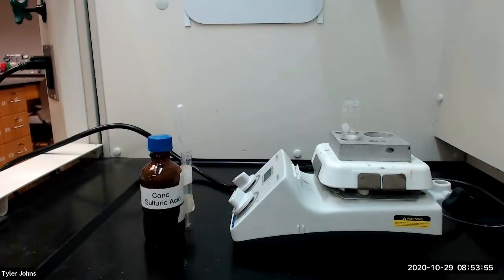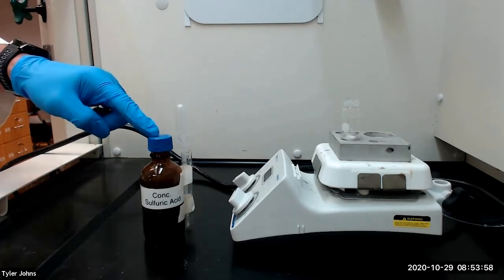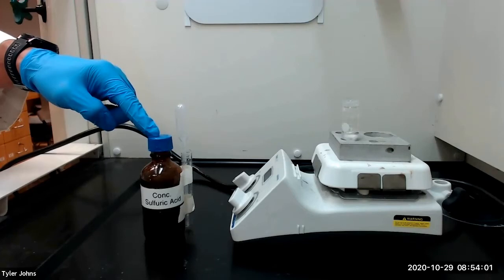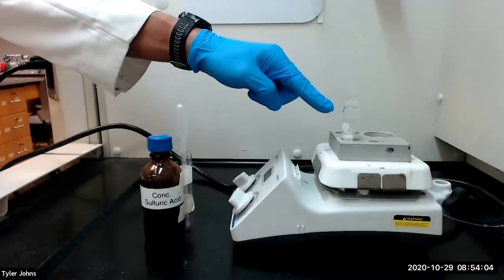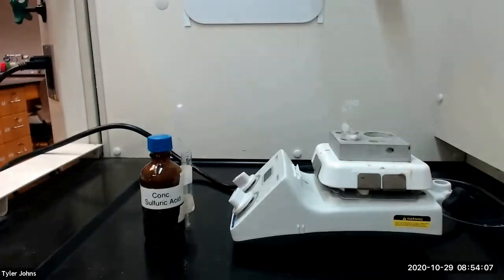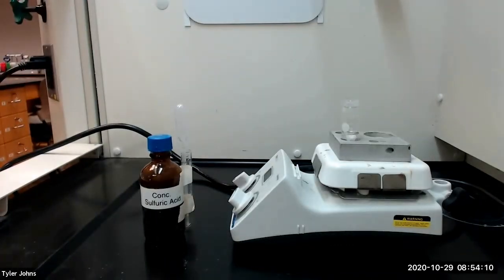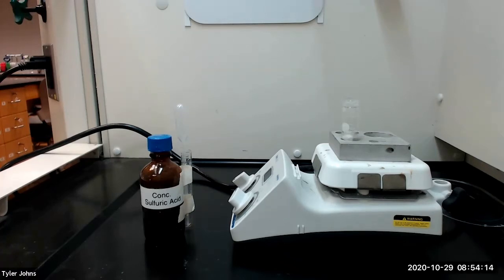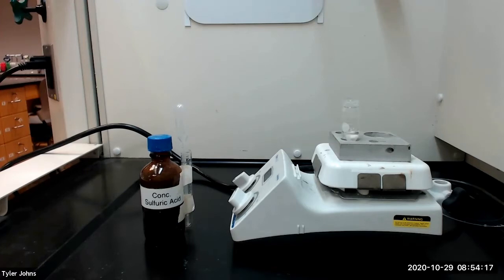After our salicylic acid has dissolved in the methanol, we will next slowly add 0.75 milliliters of concentrated sulfuric acid to our 5 milliliter conical vial with stirring. At this point a white precipitate may form, but it will re-dissolve during the reflux period. After we have added the sulfuric acid, we will attach our 5 milliliter conical vial to our reflux apparatus.